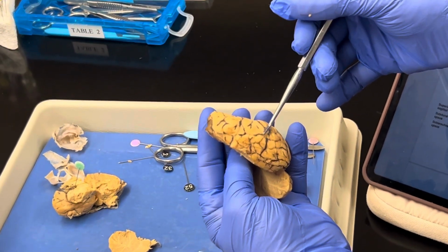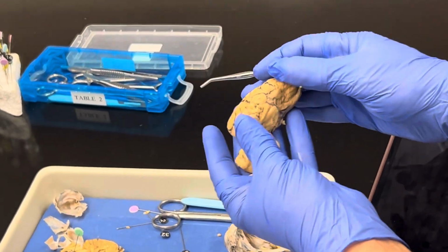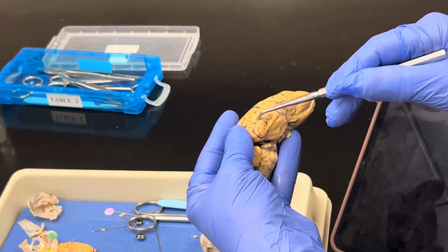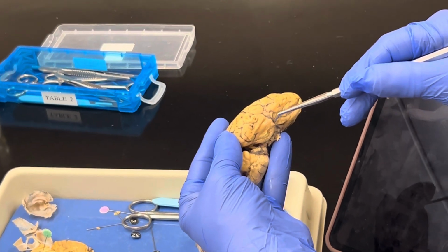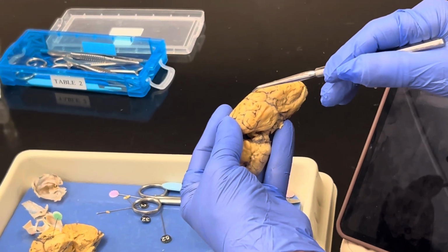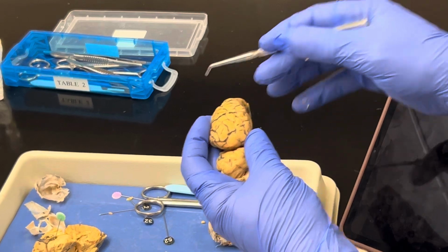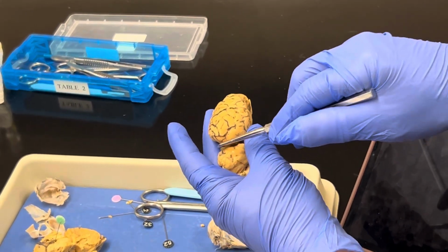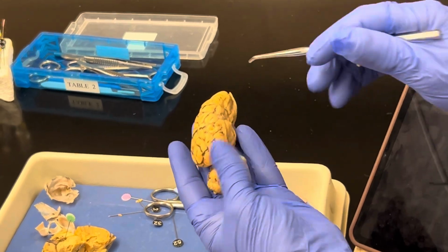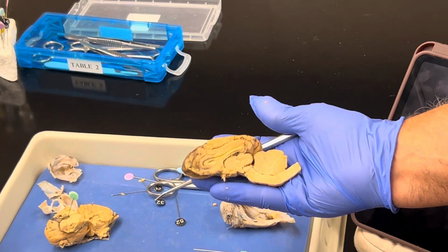from the parietal cortex. Then, if we turn the brain around this way, we will see another fissure, and this fissure is going to travel this way. This is known as the lateral fissure, or the Sylvian fissure, that separates the parietal lobe from the temporal lobe. In the back, we have this fissure known as a transverse fissure, which is going to separate the cerebrum from the cerebellum. And then we turn it around, and here we go. Yay!